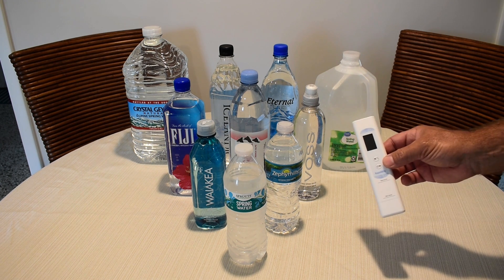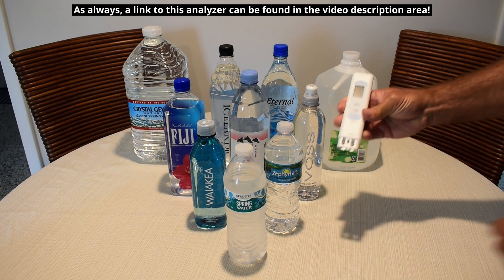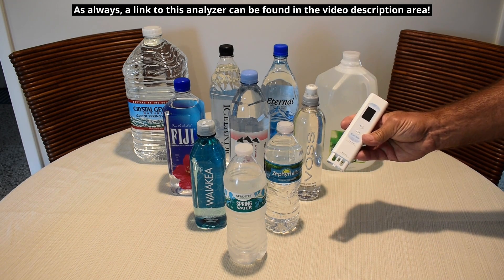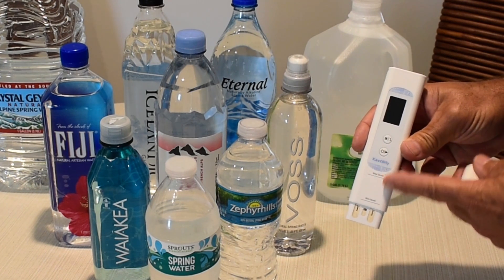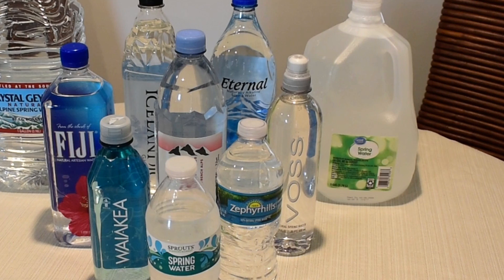The way this 6-in-1 tester works, over here you have sensors at this tip. You submerge into the sample up to that line, push the button, and it's going to give you a reading.